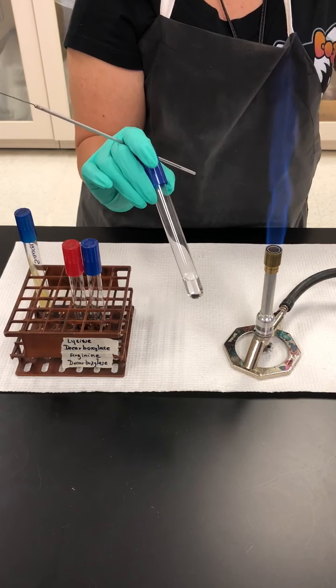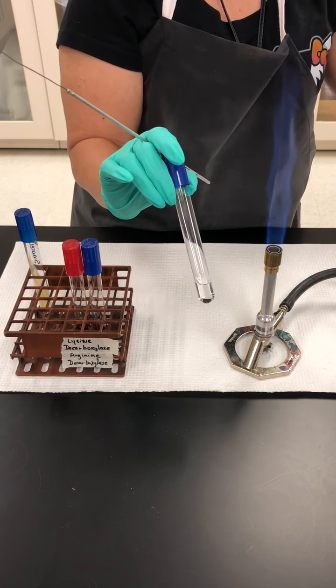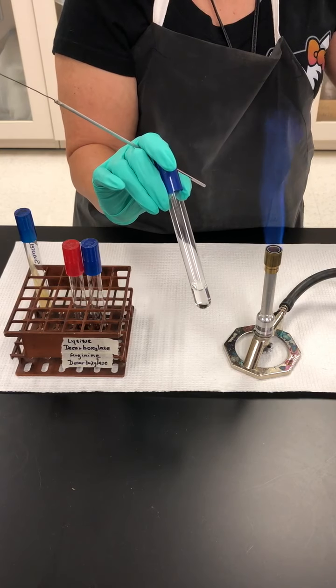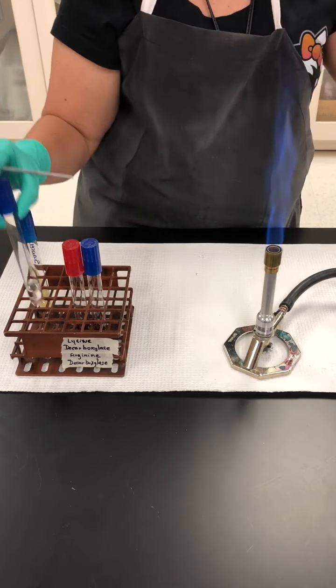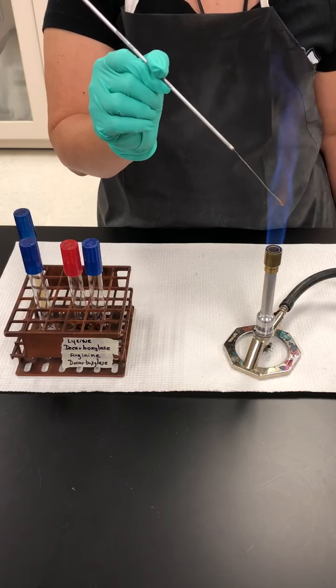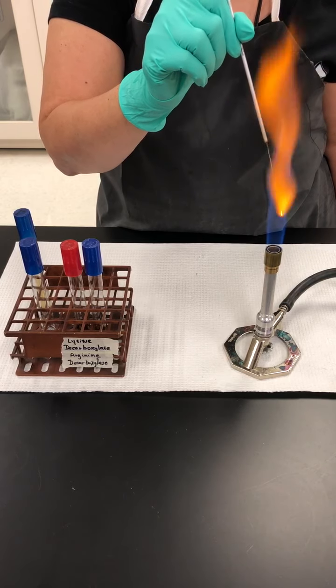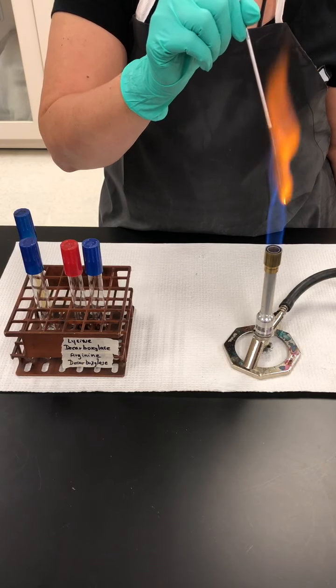Now, what we're going to do also as part of this test is create an anaerobic environment. We're going to do so by adding mineral oil on top of the inoculated broth before it is placed in the incubator. So we're going to use aseptic transfer and a loop in order to transfer the bacteria from the stock tube onto the broth.